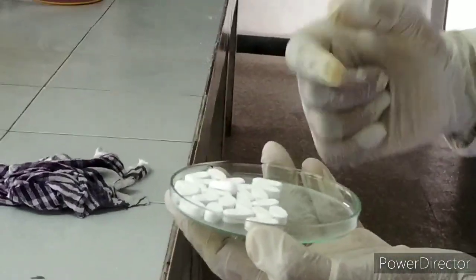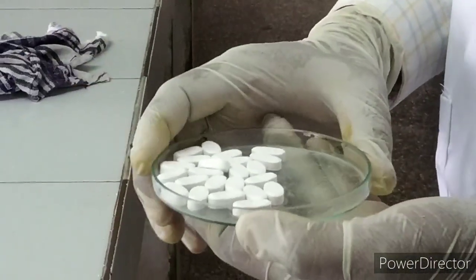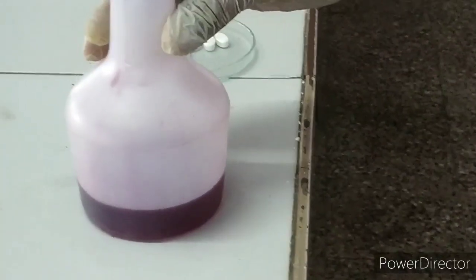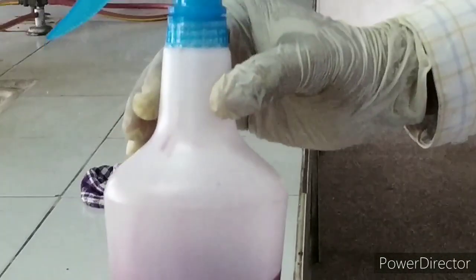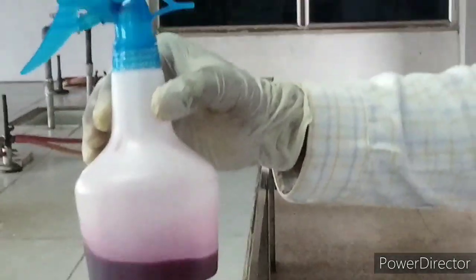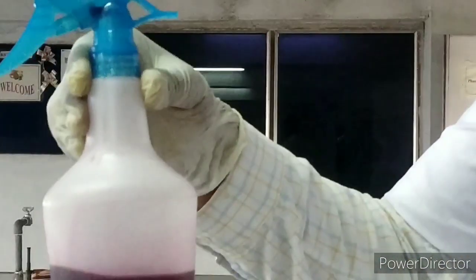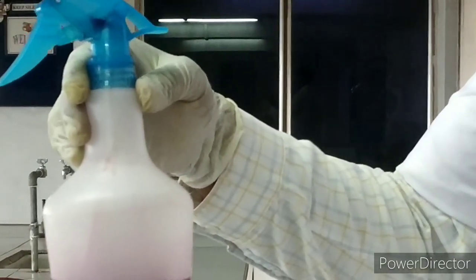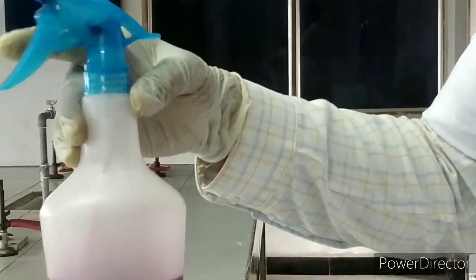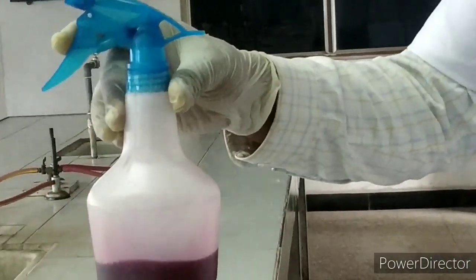These are the tablets — uncoated, simple compressed tablets. Today we are coating these tablets with the help of the coating solution. The formula ingredients are mixed thoroughly to form a coating solution. In this container, the coating solution is there. Today we are not having the spraying gun, therefore we are using a simple spraying assembly like this.